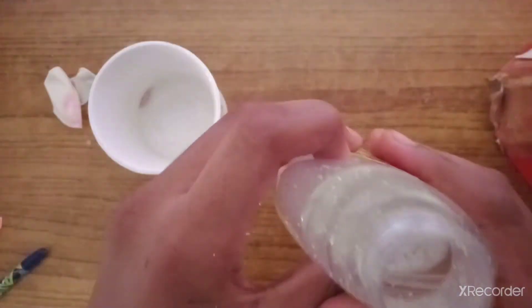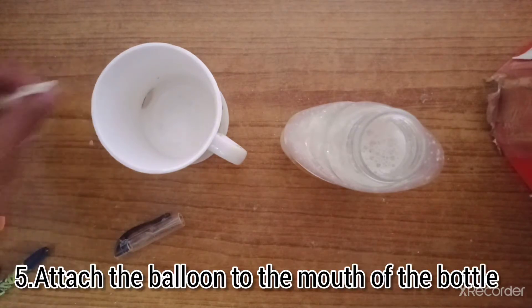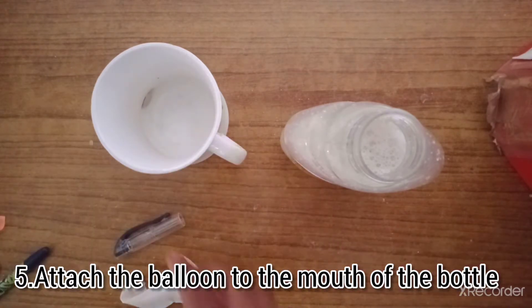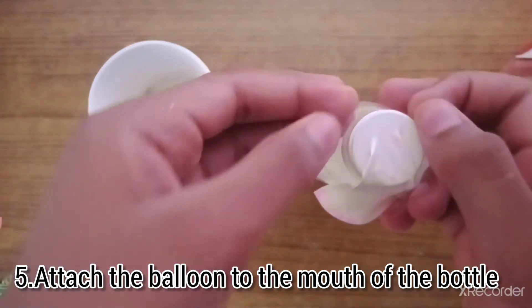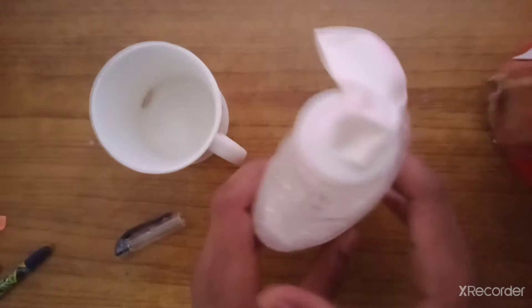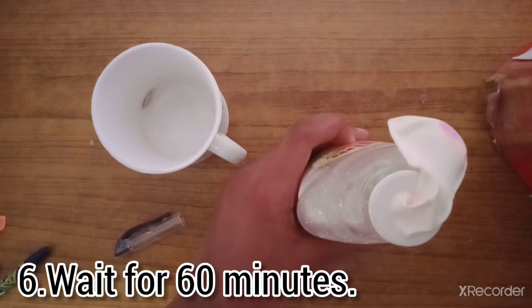I have shaken it and already we can see that it is quite bubbly on top with the yeast and sugar. Now I am going to attach the balloon to it and wait for some time to observe the reaction. It will liberate carbon dioxide gas which will fill the balloon up.